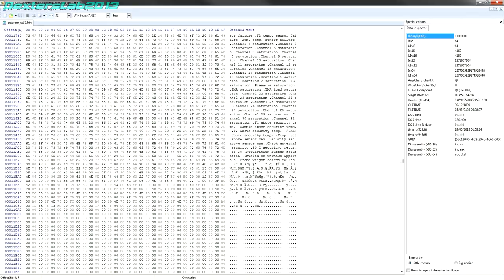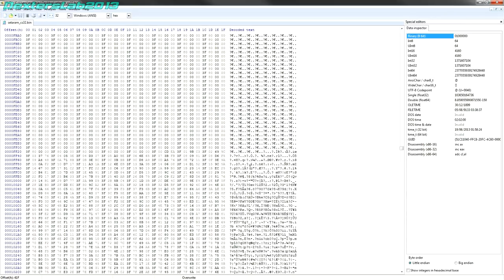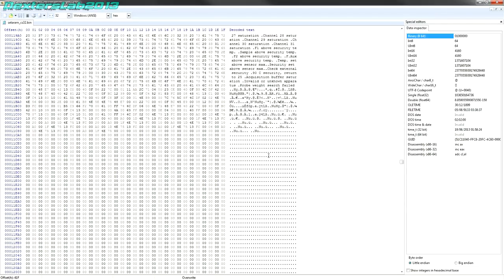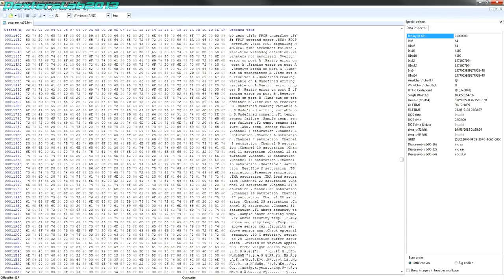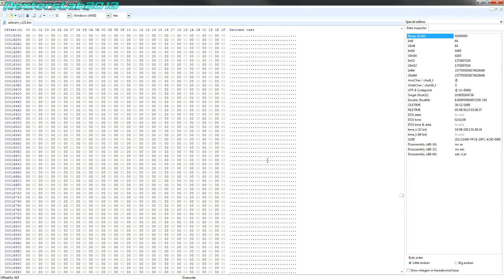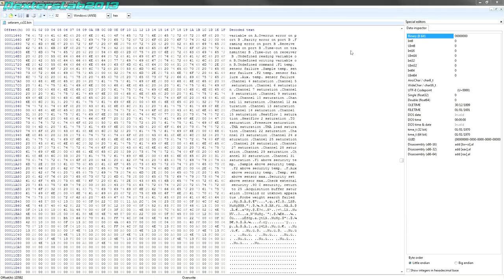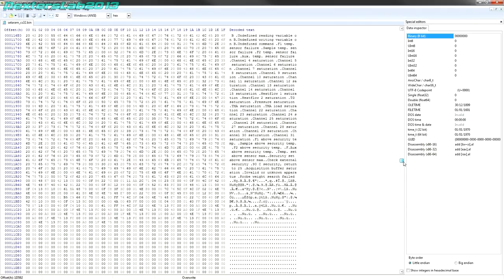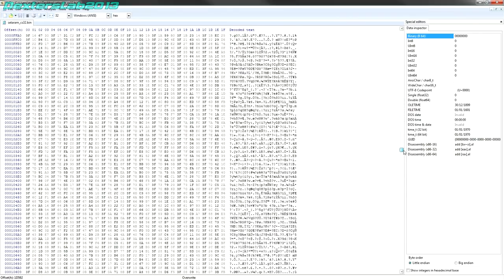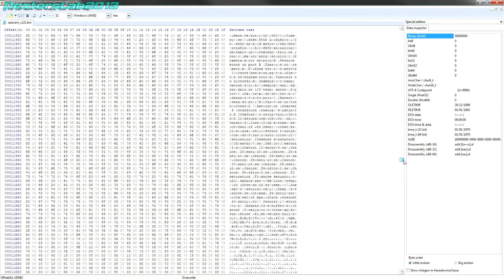Saturation, blah, blah, blah. Yeah, it's hard to tell really from what's in there what this is actually doing, but it's going to have to be doing some floating point processing in real time, presumably sending that out to the PC that would connect to it. And from then on, there is nothing else there. So looking at this, it looks like the EEPROM is about half full. So it's 128K EEPROM, so there's about 64K of actual code and stuff in here. So yeah, who knows? I wonder whether I should actually plug all this back together and see whether there's actually anything on the serial port.